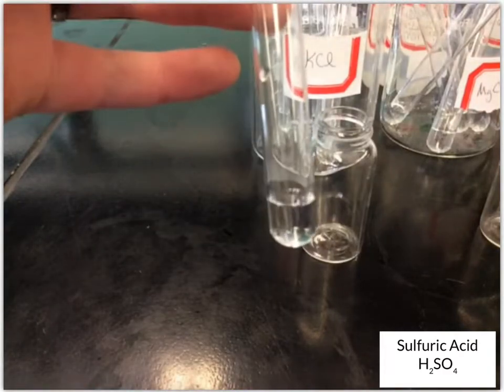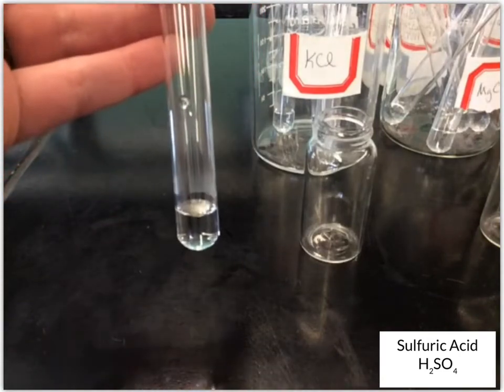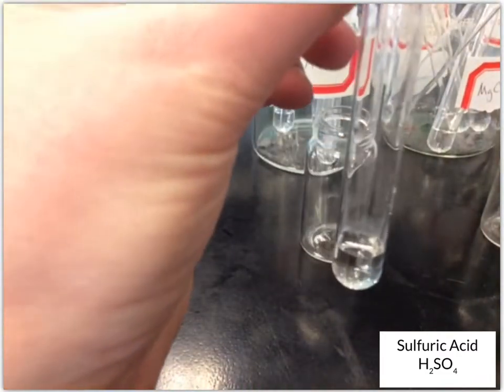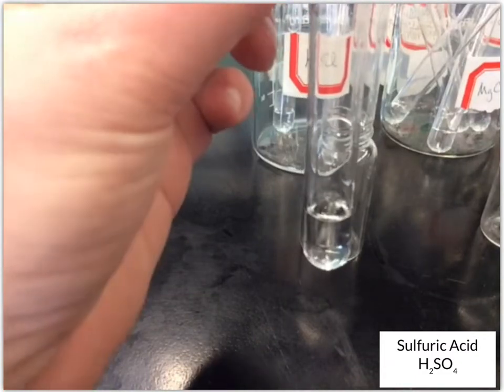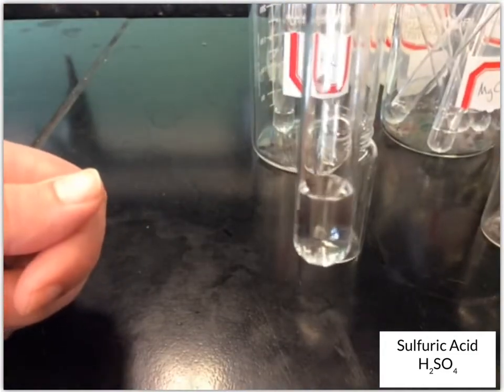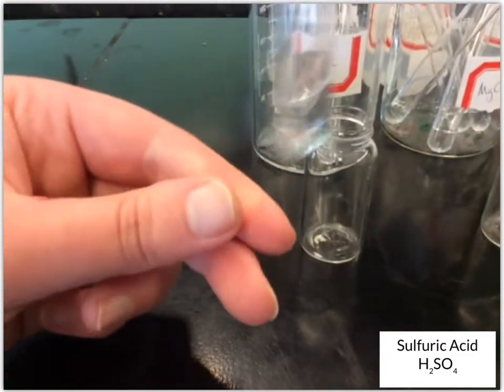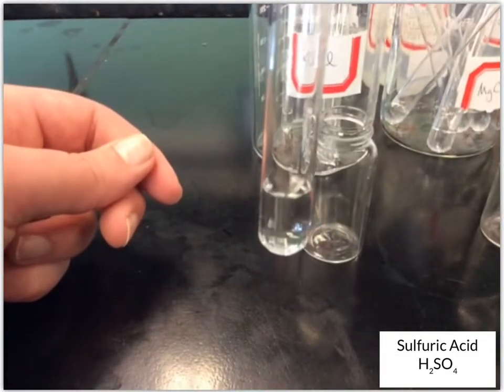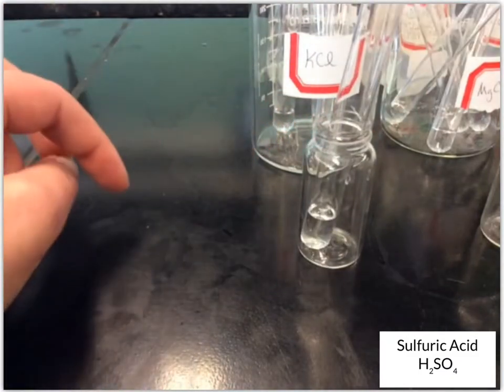Our first one, KCl, is a clear solution. Actually, all of these known solutions are clear, colorless solutions. Then I add the sulfuric acid, about 10 drops, and it still looks like a clear, colorless solution. There's a little air bubble in there from me shaking it, but it doesn't look like anything changed. So KCl with sulfuric acid, we see no change.